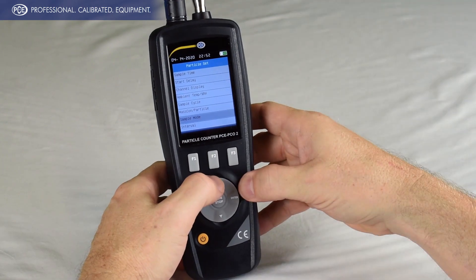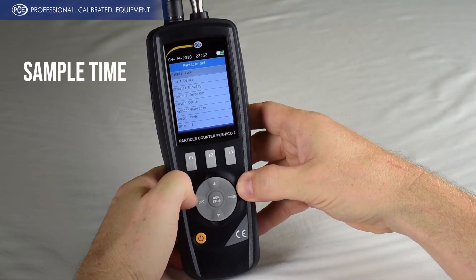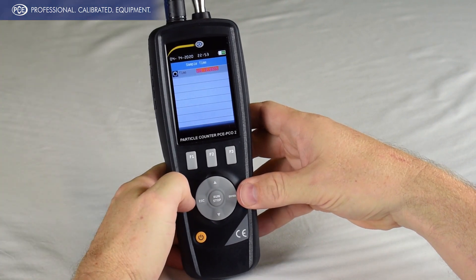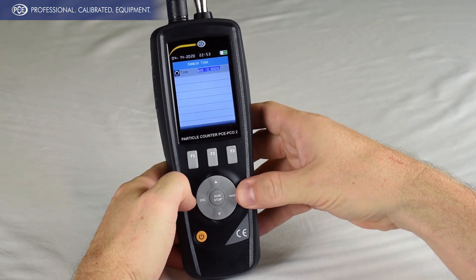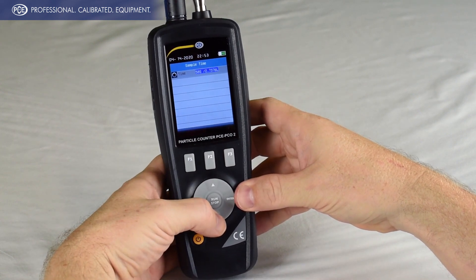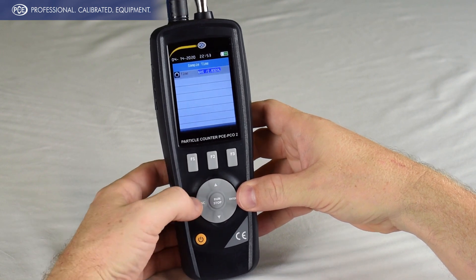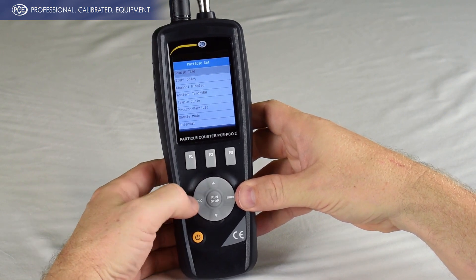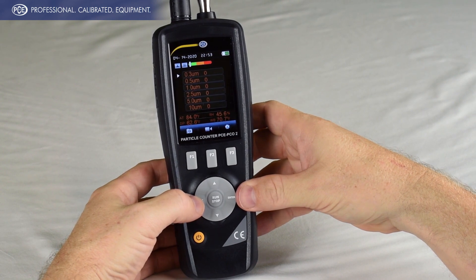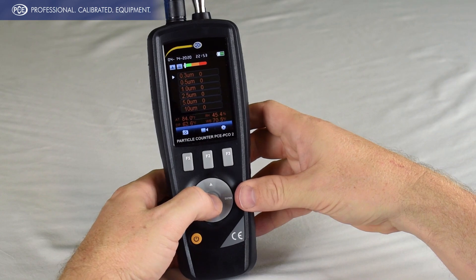The final thing we'll decide is the sample time. Go up to sample time in the settings menu, hit enter and hit enter again. This part becomes blue and then you can change your sample time. We're going to leave it for 60 seconds. Hit escape to save. Now we're going to run the sample — we'll go ahead and hit the run button here.